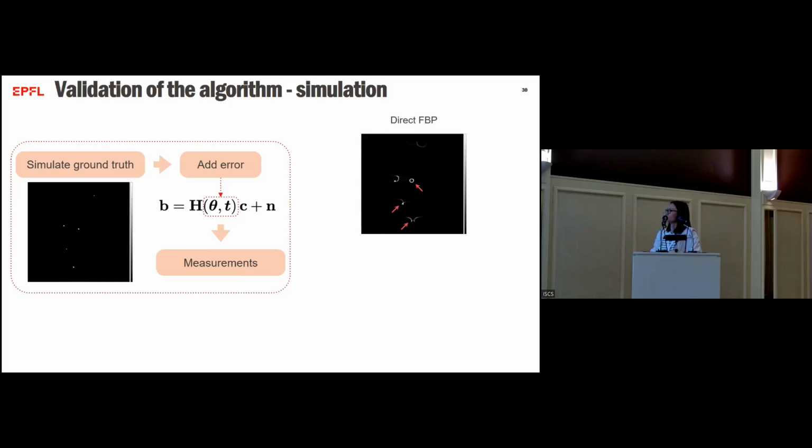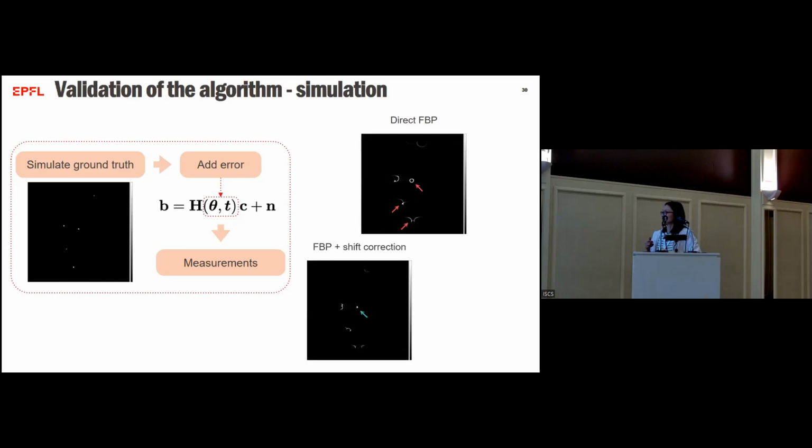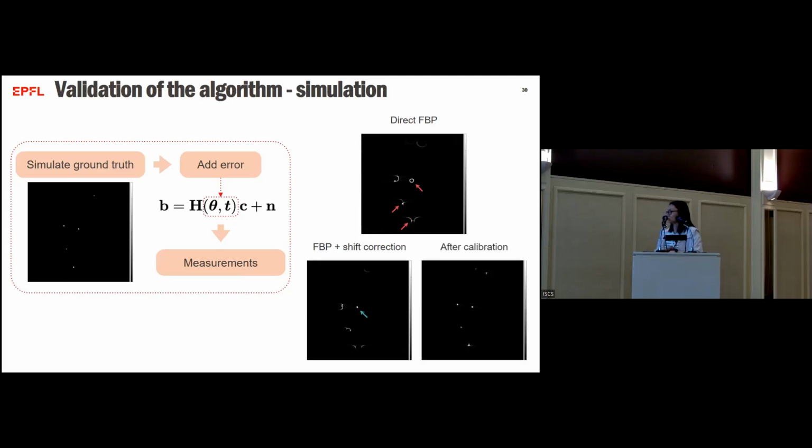So when we apply direct FBP, as expected, we see these circles that are due to the shift and these wings that are due to the rotation angle errors. When we first do a shift correction using the method I mentioned before, we see the circle goes away, but we still have some other artifacts, the wings. And when we apply our calibration algorithm, then do reconstruction, we see we manage to remove all the artifacts.